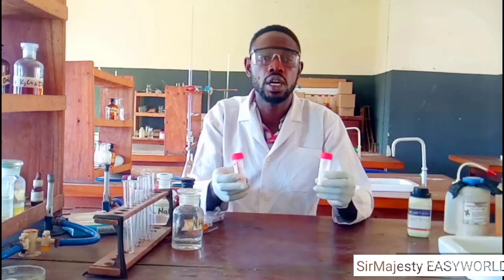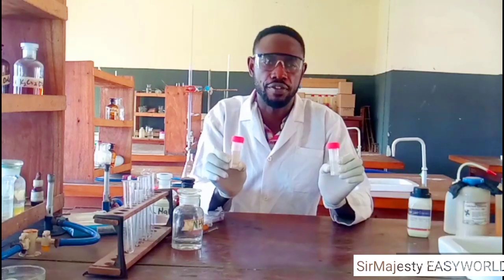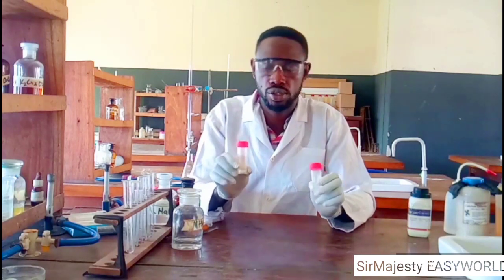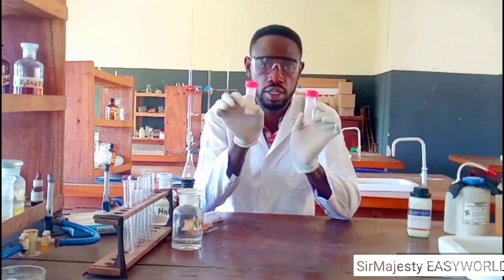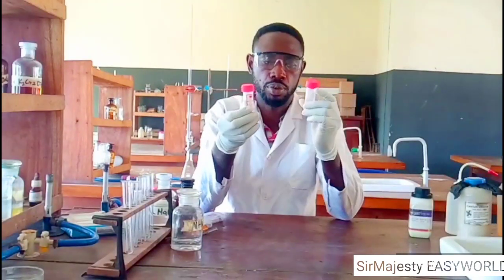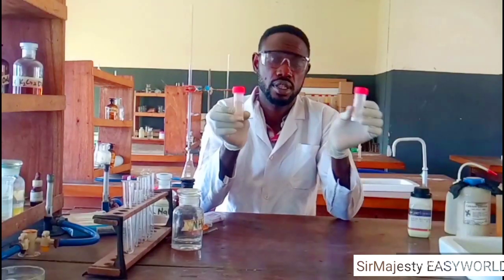Then when you mix the two, there will be a double decomposition, meaning there will be formation of an insoluble salt. Remember, double decomposition is a common approach used in the preparation of insoluble salts. So if I mix these two clear solutions, a white precipitate of insoluble lead(II) chloride will form. So just know that if you are asked to mix the two, there will be double decomposition. So you can use one to analyze the other. Understand what I'm saying here?